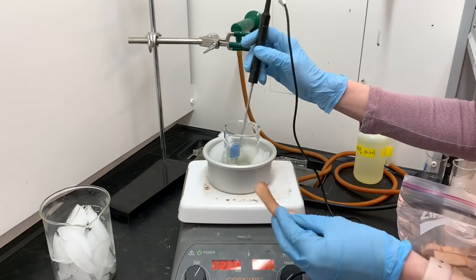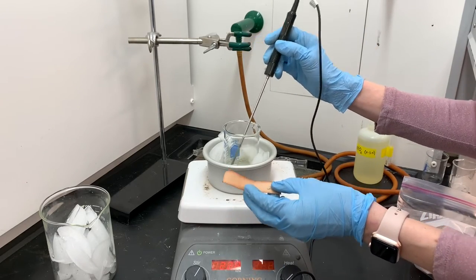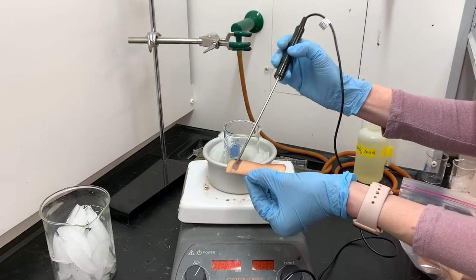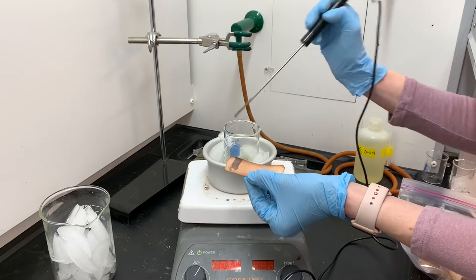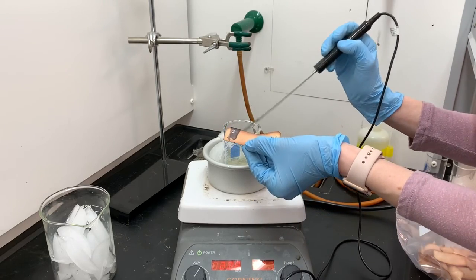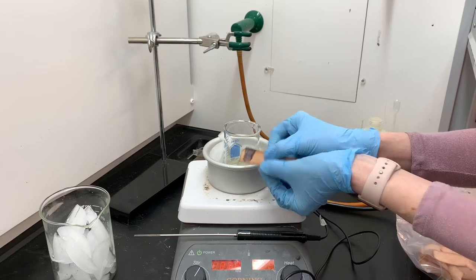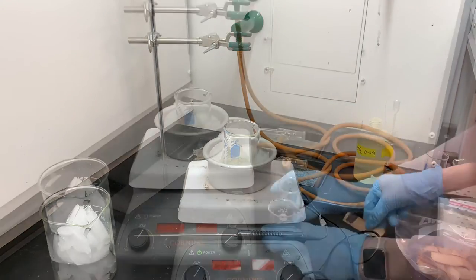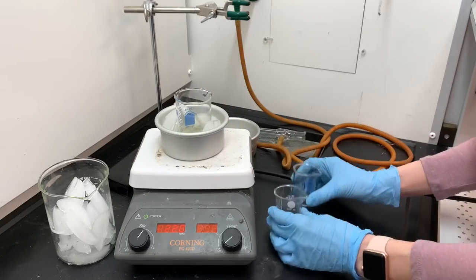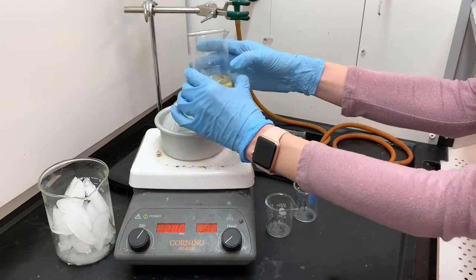I'm done adding all of the sodium nitrite and I'm going to do a quick starch iodide test to make sure I've added enough. A blue-black color lets me know I've added a sufficient amount of sodium nitrite and I can move on to the next step of the reaction. If it wasn't blue I would just add a little bit more until I got a positive test. The last thing I'm going to do is separate this into two separate beakers labeled D1 and D2 — the D is for diazo compound.